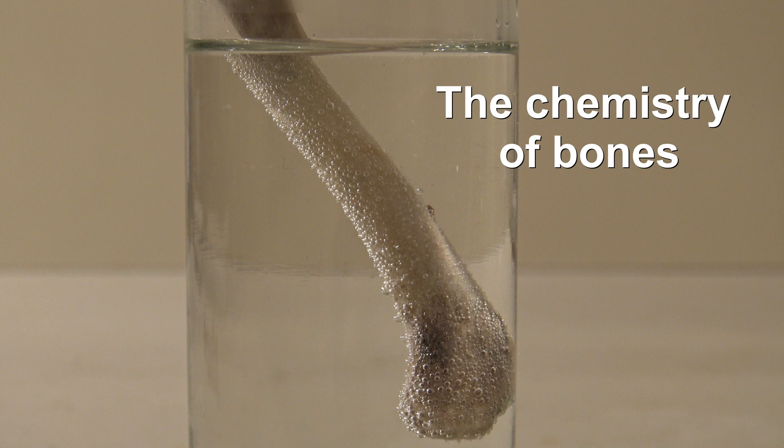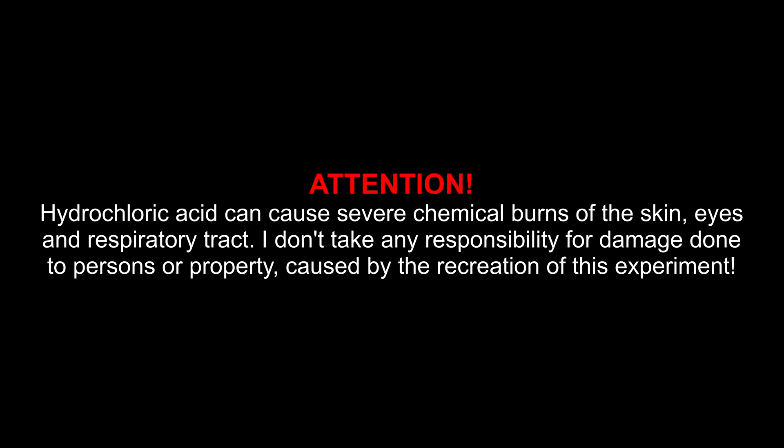The Chemistry of Bones. Hydrochloric acid can cause severe chemical burns of the skin, eyes and respiratory tract. I don't take any responsibility for damage done to persons or property caused by the recreation of this experiment.